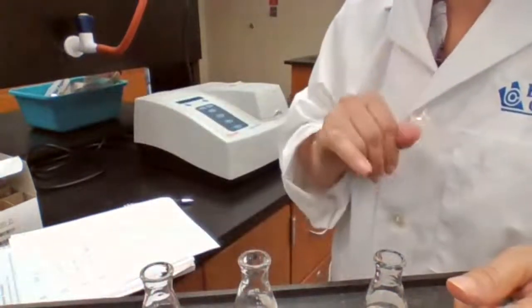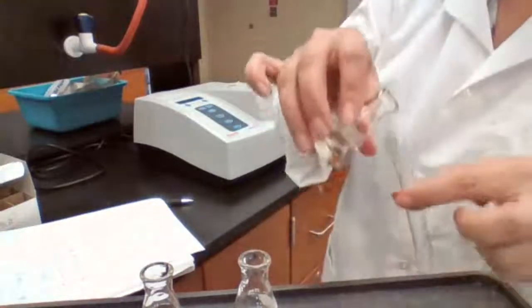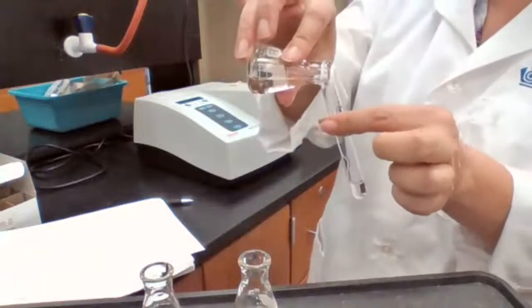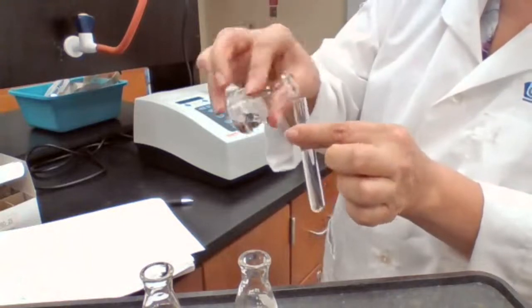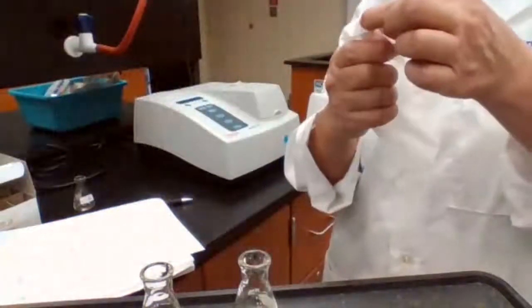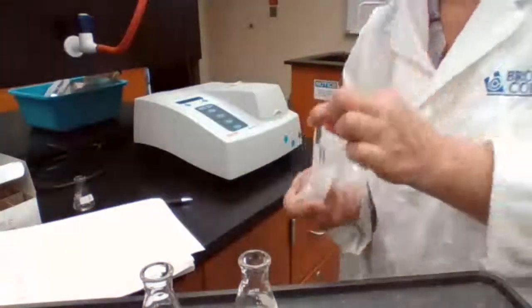My sample B is going in at 2:03. I have to get ready to put my sample into the test tube. It's actually not a test tube, it's called a cuvette. It has a special mark on it. It's a special brand of a test tube. And these cuvettes are special glass that doesn't have absorption of the light, and they are better quality than regular test tubes.